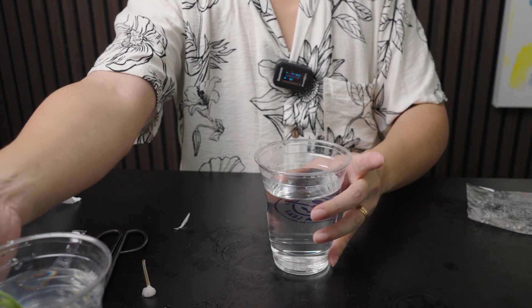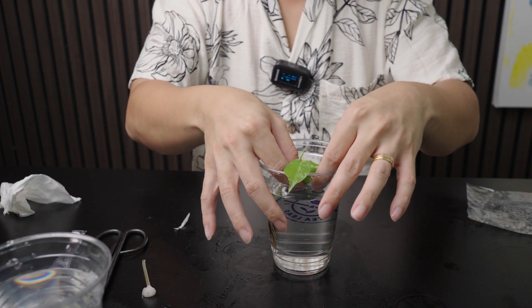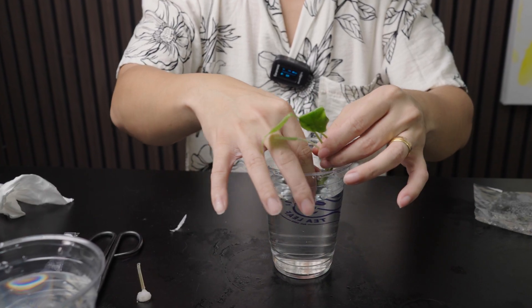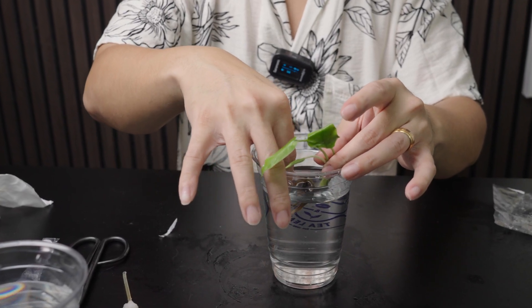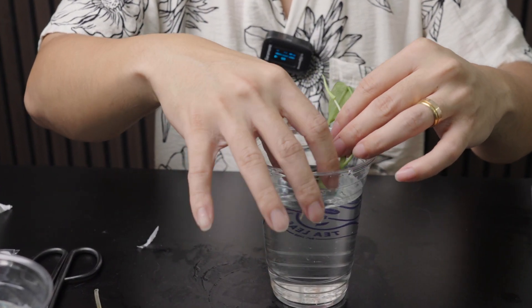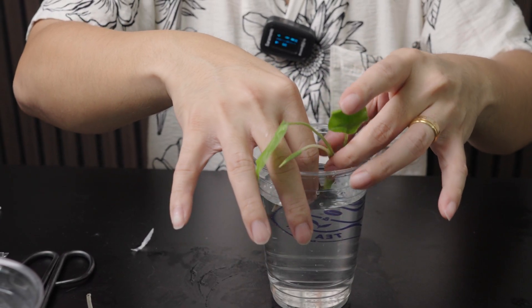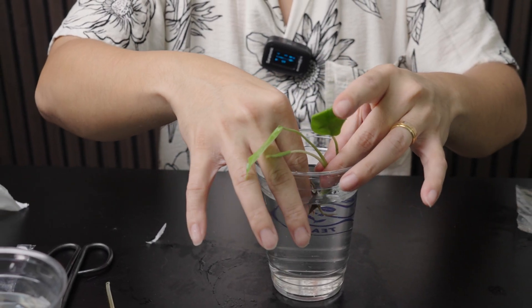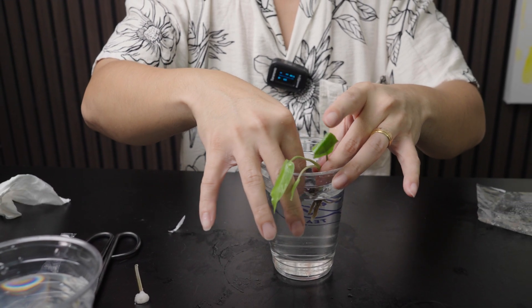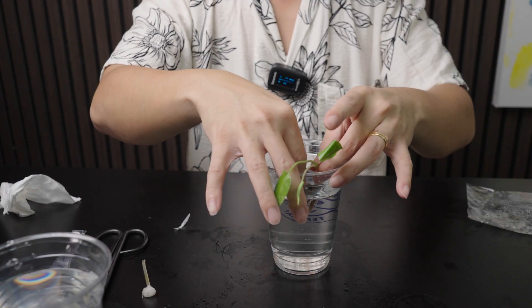That's one done — we are going to treat the second plant next. I want to be extra thorough with this particular plant because the jelly substrate looks like it was infected. I really want to get in there and rub off every bit of jelly on the roots. You might damage the roots while doing this, but honestly it won't matter as much as you think — the roots grown in tissue culture typically die off anyway because they can't acclimatize to conditions outside of tissue culture. They're always good to keep on though, as they help the plant acclimatize while it's throwing out new roots.